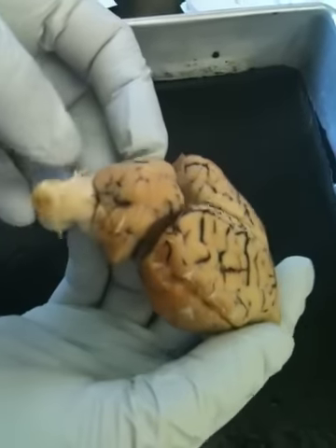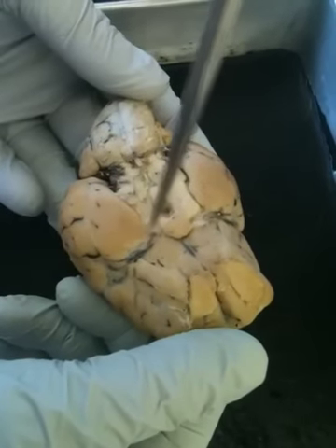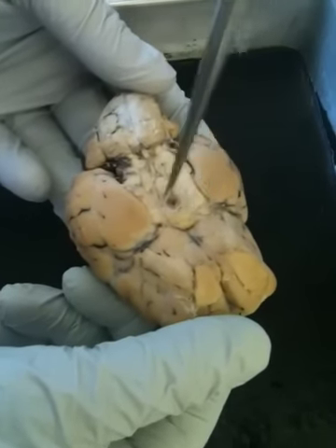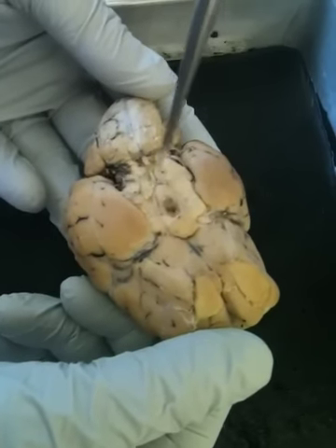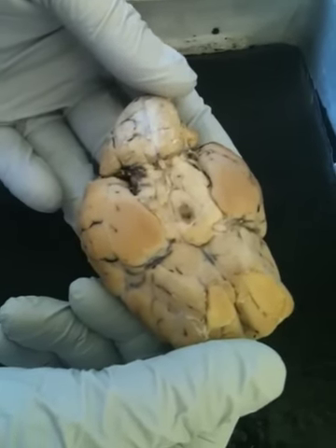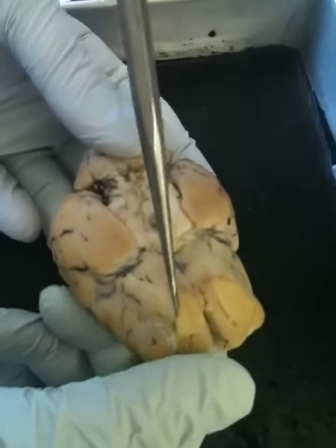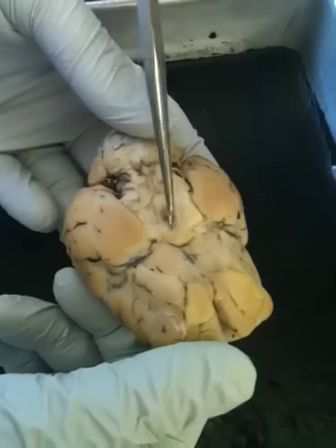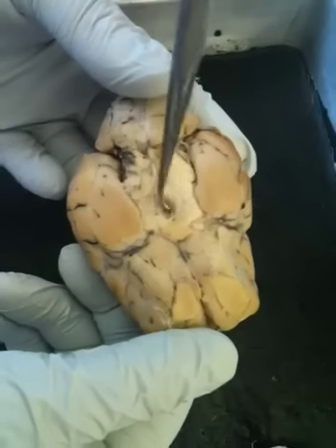The diencephalon is an area. It's the middle. It contains the optic nerves, where the optic chiasma would be, and the mammillary body. The optic chiasma is where the optic nerves come out, but it would be right here, right above the pituitary gland, the hole of the pituitary gland.